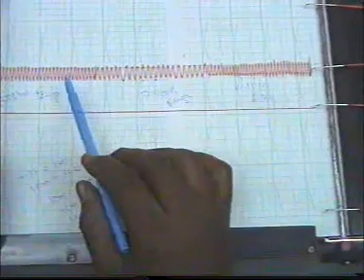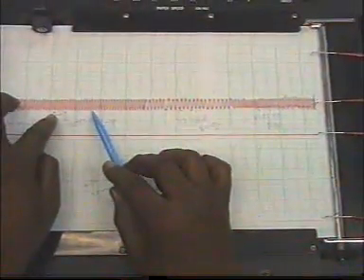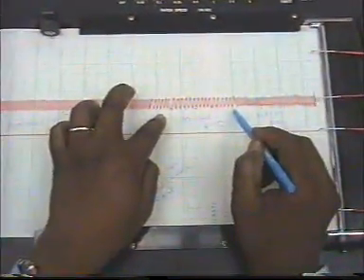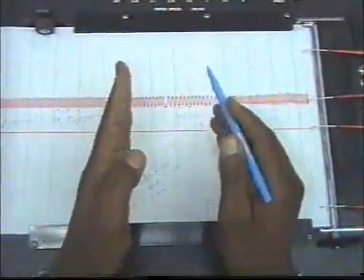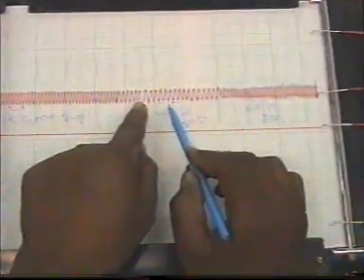It will be more accurate if, for example, 1 centimeter is 4 seconds, we take 2 centimeter or 5 centimeter, depending on the records available. So the error will be less, and the difference will be clear.